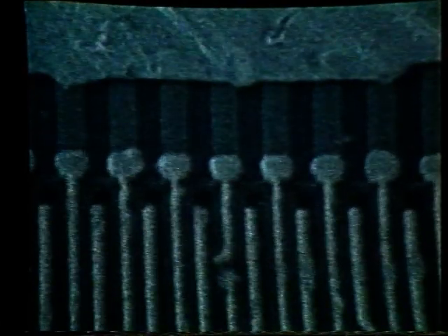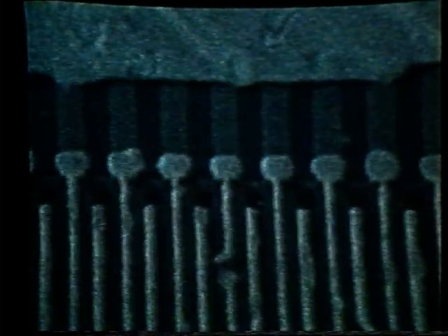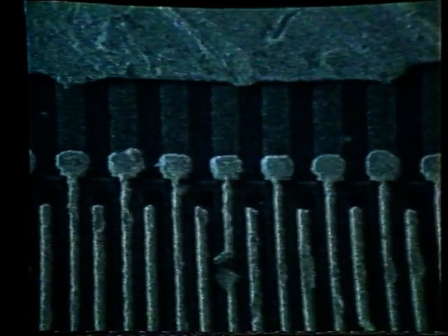What we will do now is, since we have minimized most of the movement, to more fine-tune, let's change our magnification once again to 10,000x. Pressing function key number 2 will exit us from the objective lens rocking. We can enter a magnification of 10,000. Let's also use the fine focus and refocus the image. Let's also recenter the image using the XY micrometers.